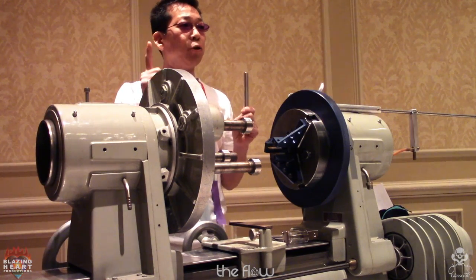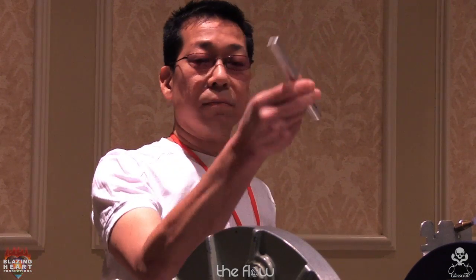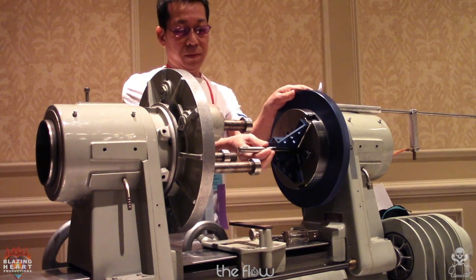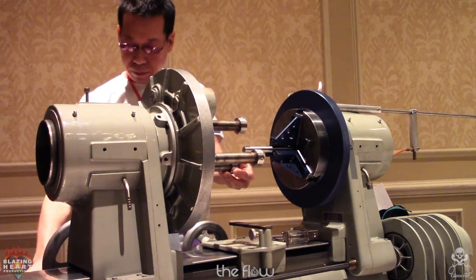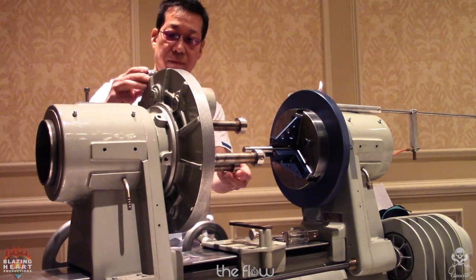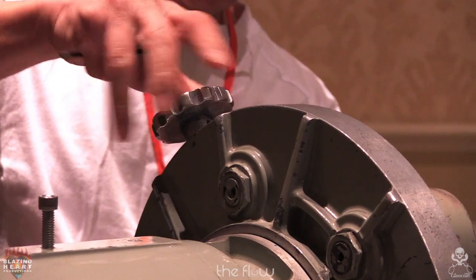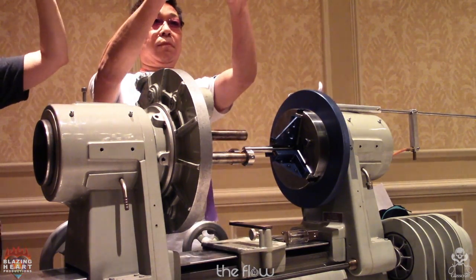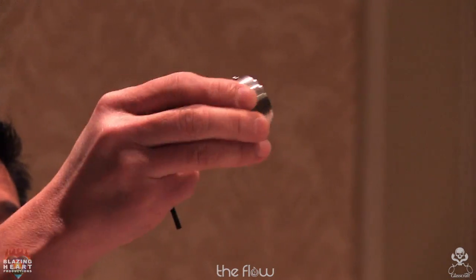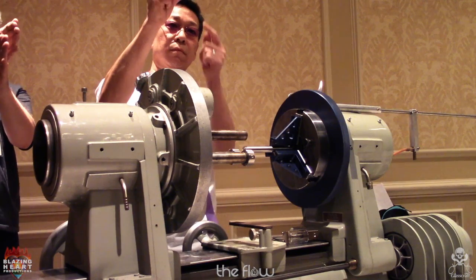It's very fast. From here is the most important part, the key point: the stainless steel rod. He's got stainless steel, centerless ground, and a flat face cut on the end of the tube, so he's got a nice sharp 90 there. These are stainless steel donuts, and there's a little offset cut into the open end of the donut. Normally the donut end is just 90 degrees.